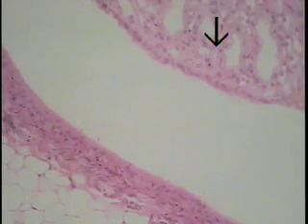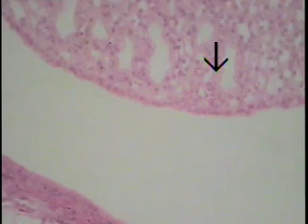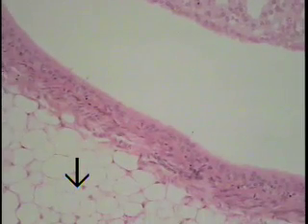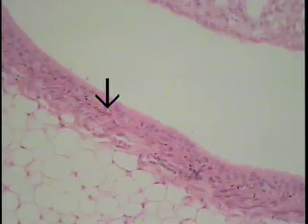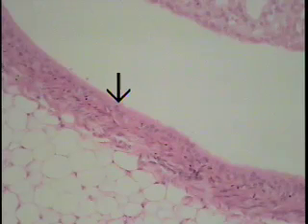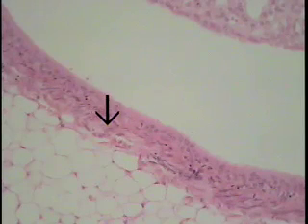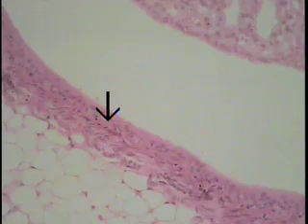Finally, a high-power view of the tip of the renal papillae, which is shown here at the pointer. You can see that there are several of these very large collecting tubules with more of a columnar type of epithelium — so this is the edge of the renal papillae with a cuboidal or columnar type of epithelium. You then cross the space, and the arrow is now pointing to the wall of the minor calyx. The wall of the minor calyx consists of a very thin transitional type of epithelium — that type of epithelium that lines the excretory part of the urinary system, that is the minor and major calyces, the ureter, and the urinary bladder. You can also see the beginnings of a very thin smooth muscle wall, characteristic of the tubes conducting urine away from the kidney to the urinary bladder.